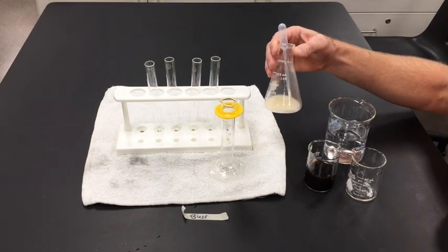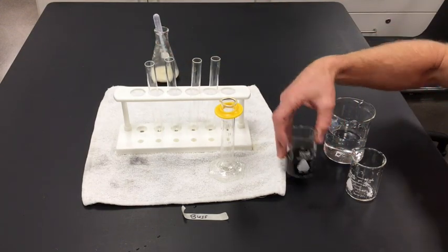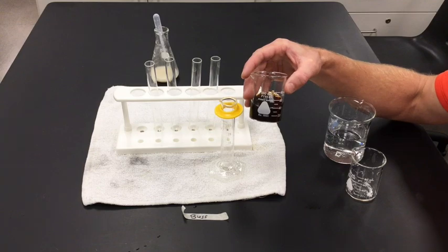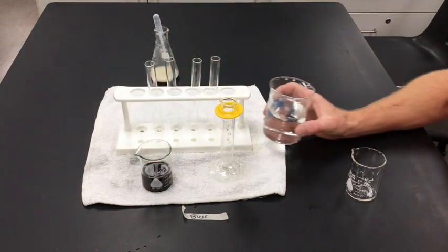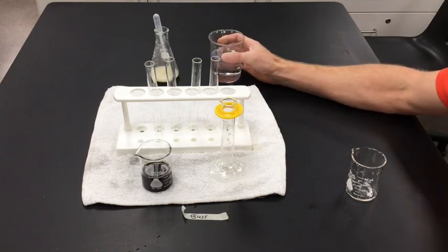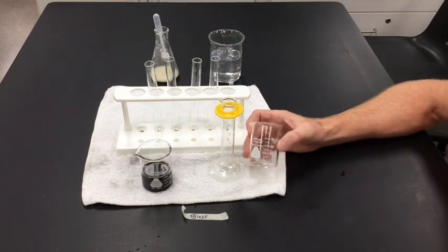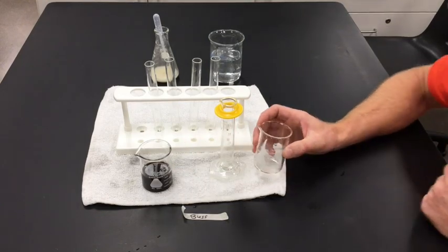The yeast I won't need right away, so I'm going to set that off to the side for now. This is molasses solution — we'll need that in the beginning, so I'll keep that in front. Some water in a larger 250 mL beaker for dilutions, and another smaller empty beaker — this is a 100 mL beaker — that I'll be using.